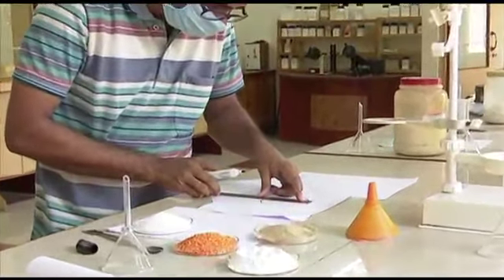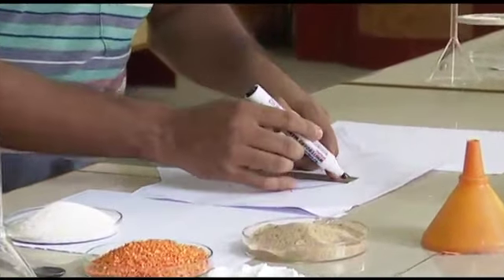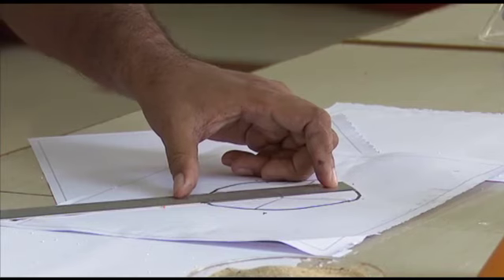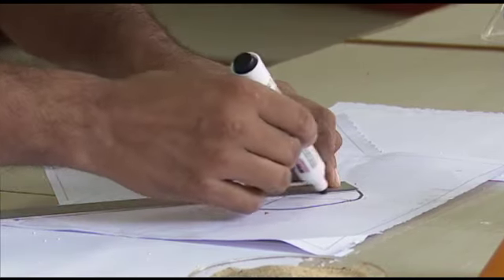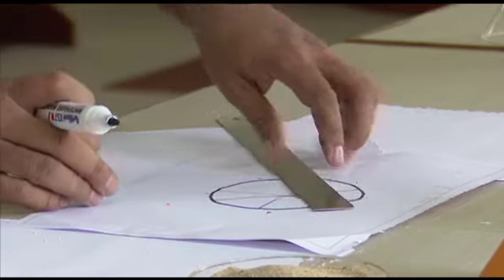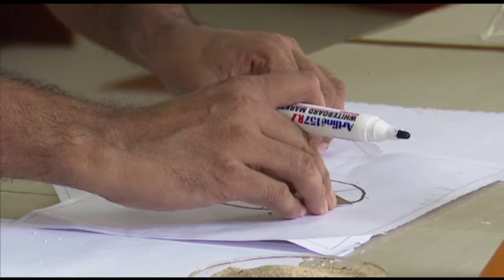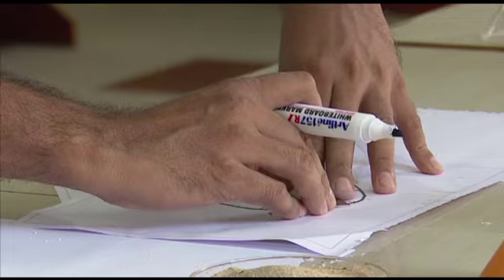If you take at different points, then you won't be getting that value. Another one. If you make more lines, more diameters, it will be more accurate, but minimum you have to take 3 measurements to be statistically valid.